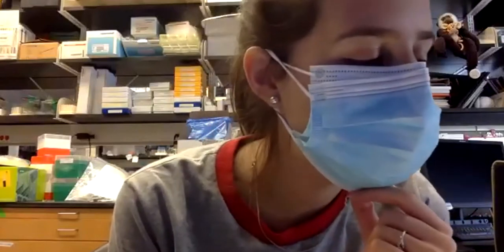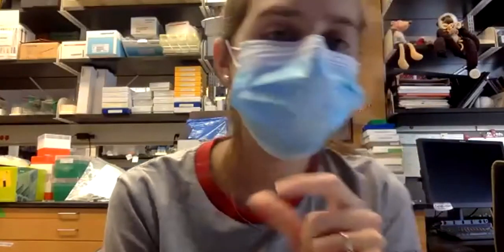They have the donor, but they don't have the guide, so it won't cut out, and they will metabolize the X-gal, and metabolized it's blue. But in the very beginning, like before we put the plasmids and all of that, the plates are blue, right? Yeah, because of the metabolite of X-gal.